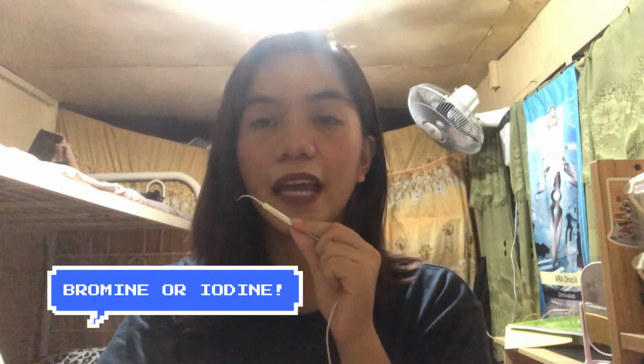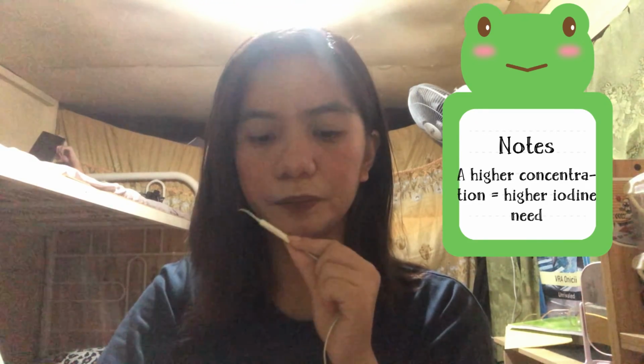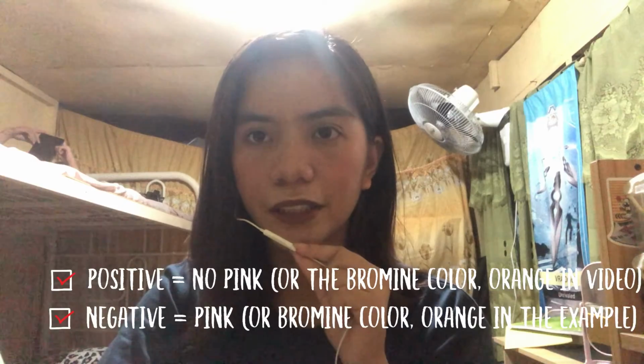As you can see, unsaturated fatty acids have double bonds and become saturated when they absorb bromine or iodine. A higher concentration of unsaturated fatty acids or double bonds means a higher iodine need. So it is considered positive if a pink color disappears and negative if a pink color appears.